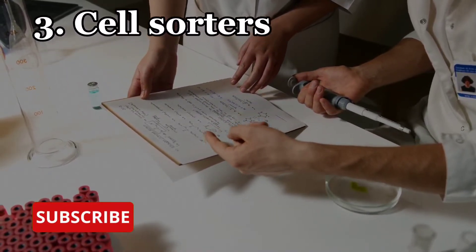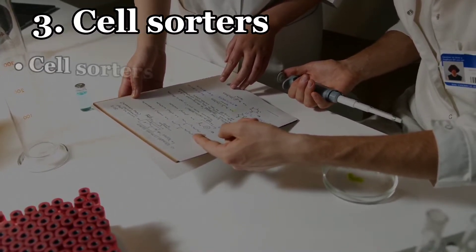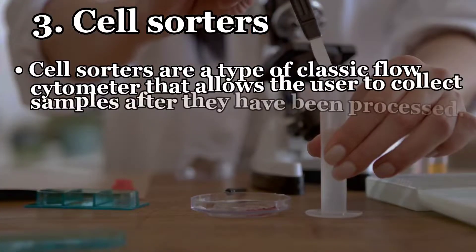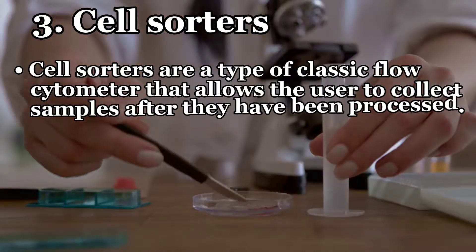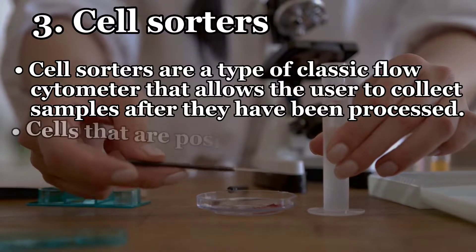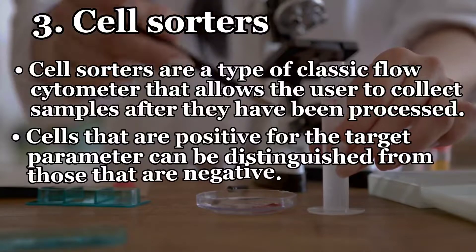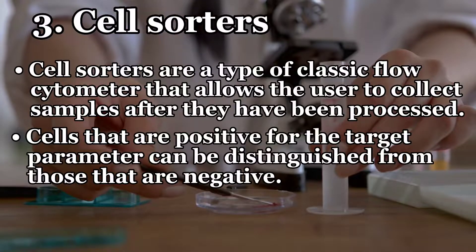Cell sorters are a type of classic flow cytometer that allows the user to collect samples after they have been processed. Cells that are positive for target parameters can be distinguished from those that are negative.